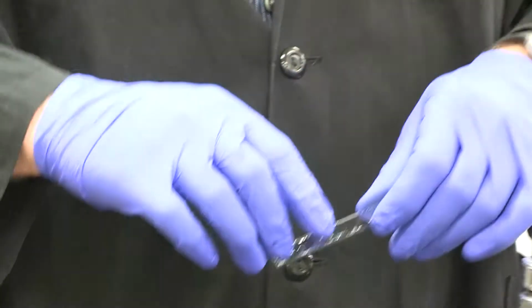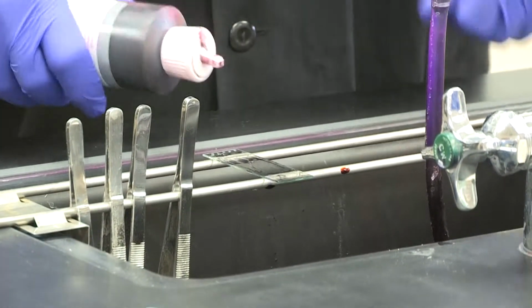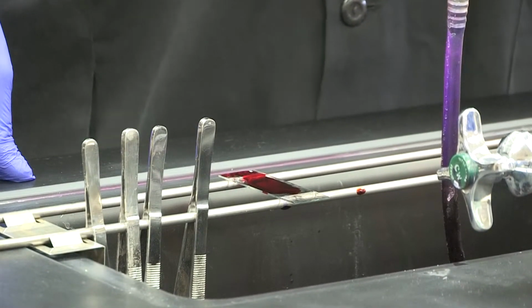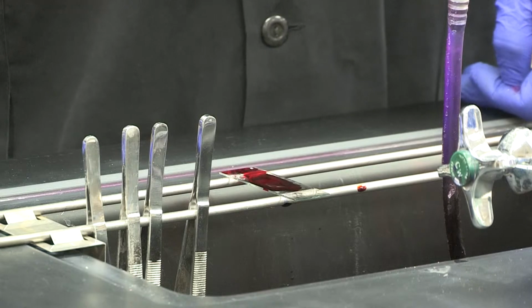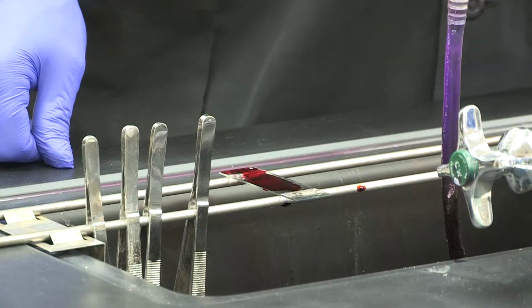but for the sake of completing the stain, we're going to go to the last step, which is adding the counter stain, which is the safranin dye. Now, if I had a gram negative, it would have been clear after the alcohol step, and then it will turn pink at this step. If I did not have gram negative, the purples that I had for gram positive are still going to be purples. And so again, this step is 1 minute.